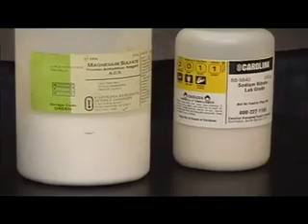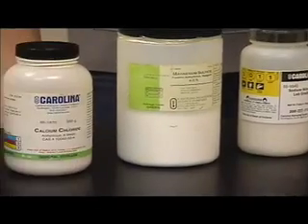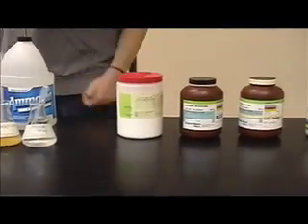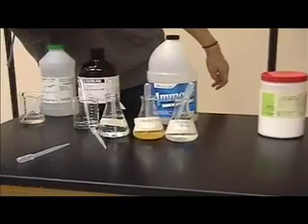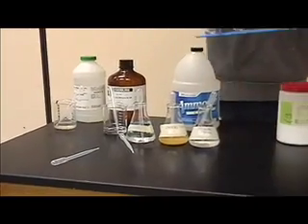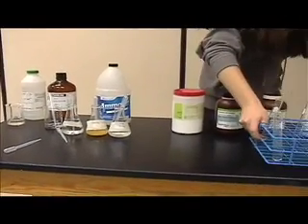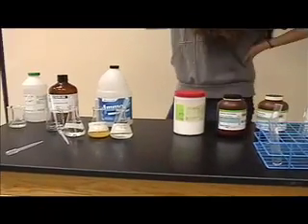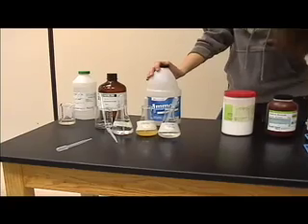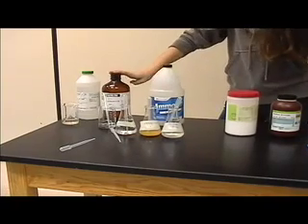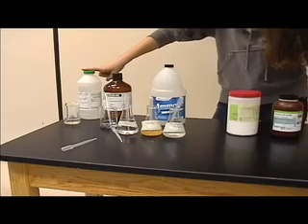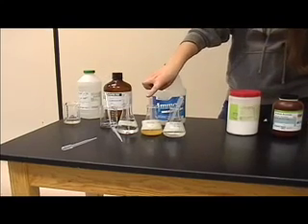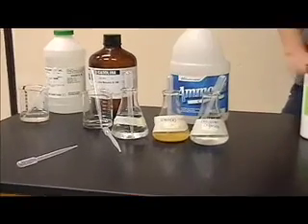Now to test for these six different anions, we're going to need lots of different materials. The first one being a test tube rack and six thoroughly washed test tubes, because we don't want any contamination. And now we're going to need a few more things. First thing is going to be ammonia, next will be silver nitrate, then hydrochloric acid, then barium chloride, then iron sulfate, and lastly nitric acid.